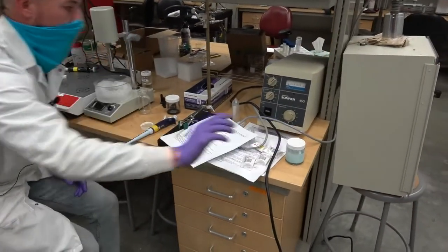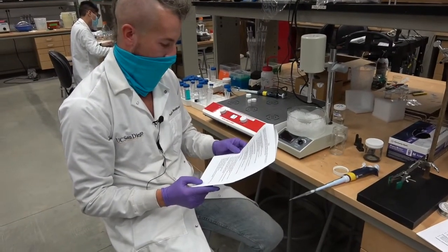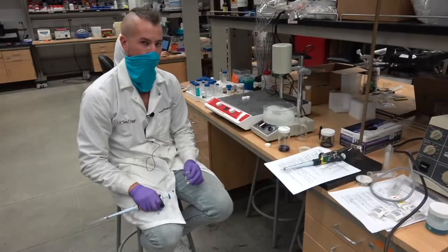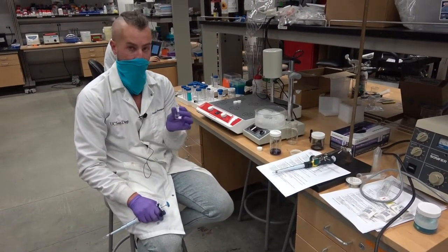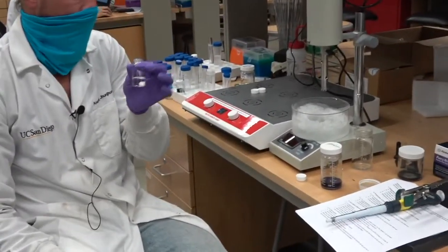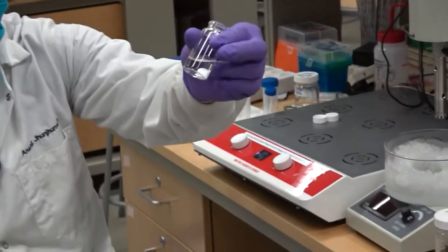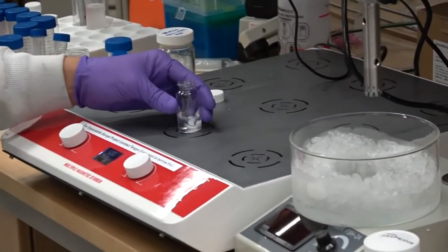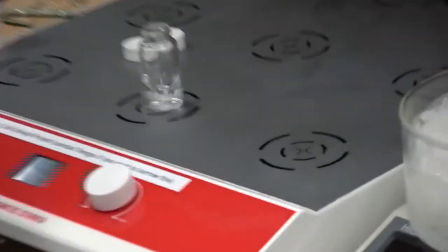So while that evaporates, we can come over and make our microparticles. Actually, let's pause right there. So this is now part 3.2, and we're going to make the microparticles. And so here we're just simply using a stir plate. So you can appreciate I've got this scintillation vial, and there's a stir bar in the bottom, and if you come in and zoom, you can see it stirring.